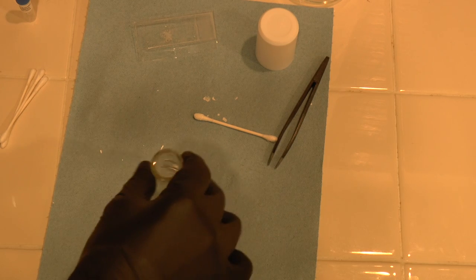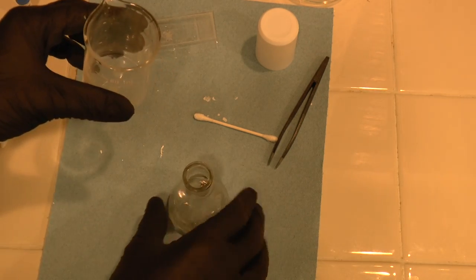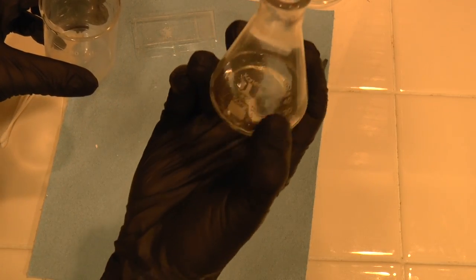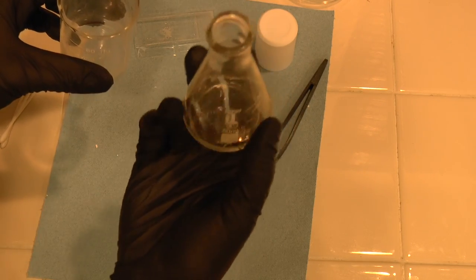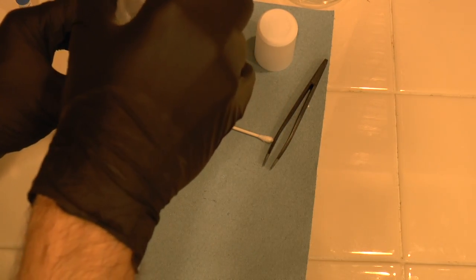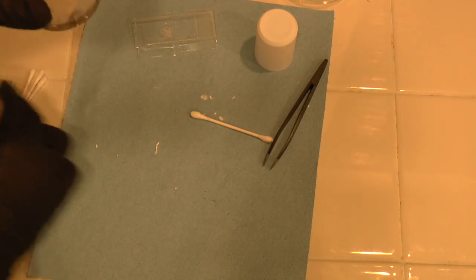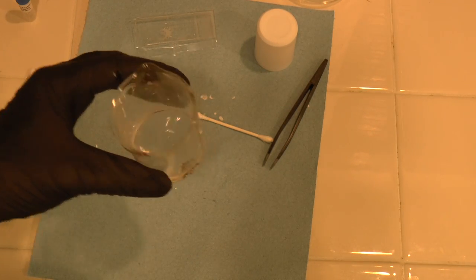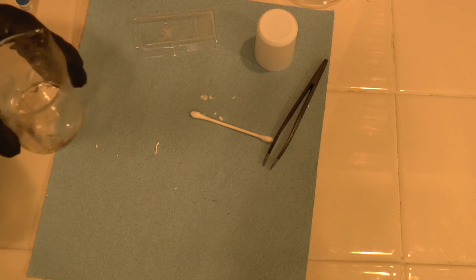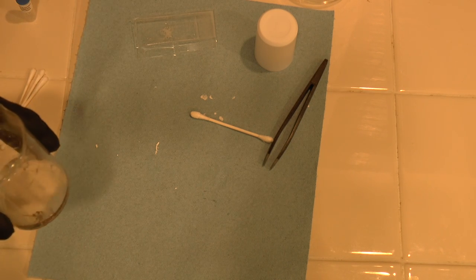Except there is still stuff in my other beaker. So here we go. Dumping it out in. One, three, two, one. There we go. That basically carries all of the stuff out of the beaker. Now I've got a much more convenient beaker and I can reach inside and grab things from it.